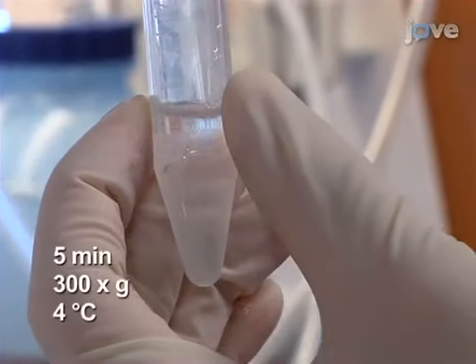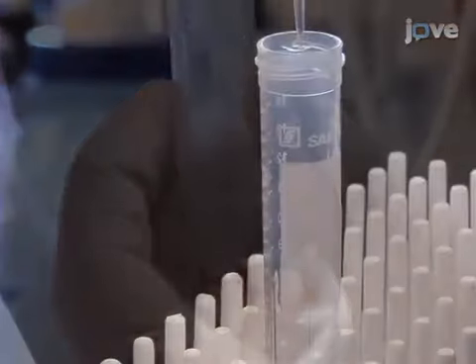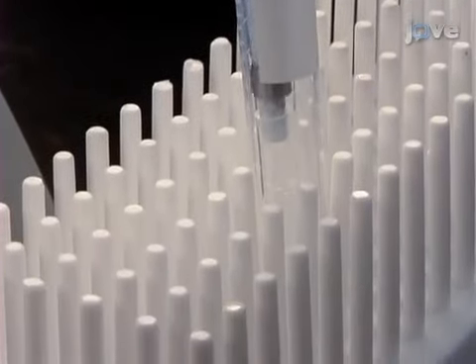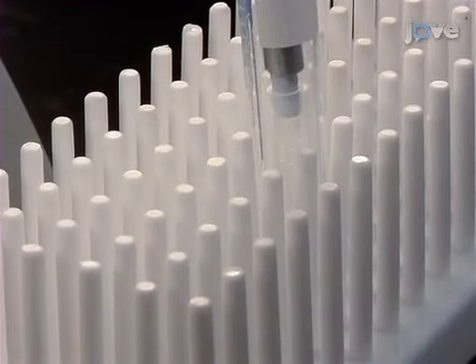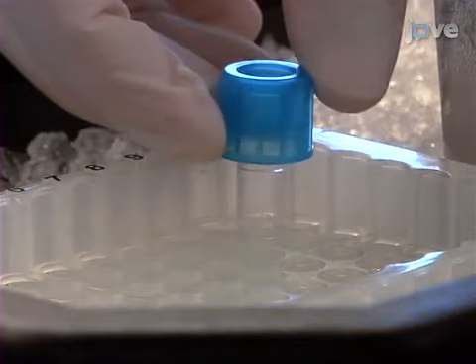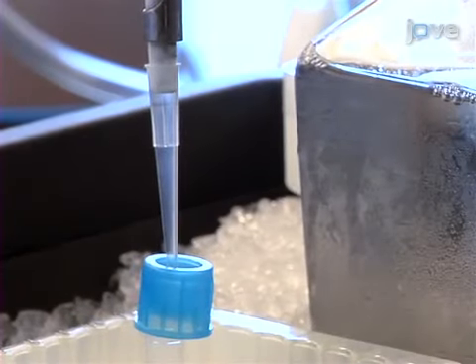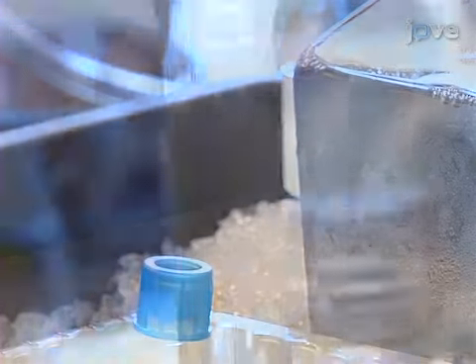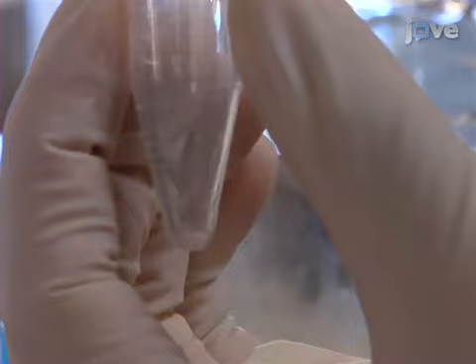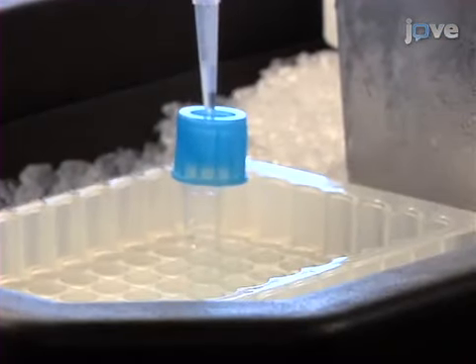Then, after washing each tube in 5 milliliters of sorter buffer, carefully aspirate the supernatant from the bound fraction samples and resuspend the cells in 200 microliters of sorter buffer. Transfer the cells into 1.2 milliliter FACS microtubes and then rinse their previous tubes with another 200 microliters of sorter buffer, pooling the rinses into the corresponding microtubes. If clumps are apparent, pass the cells through a 50 micron filter.